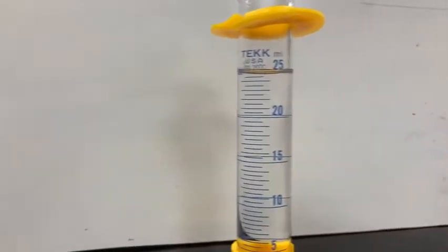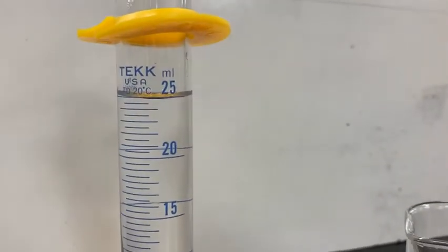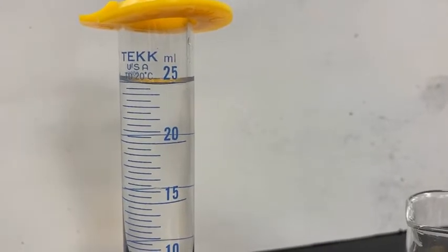And I'm going to slide over. There's the beaker we're going to mix in. But here's the strontium chloride, the 0.3 molar, sorry. That's really strong if it were 3. And it says to mix with about 25 milliliters at first.